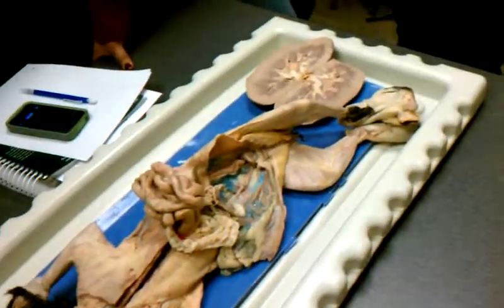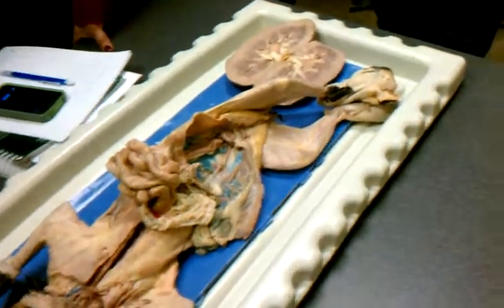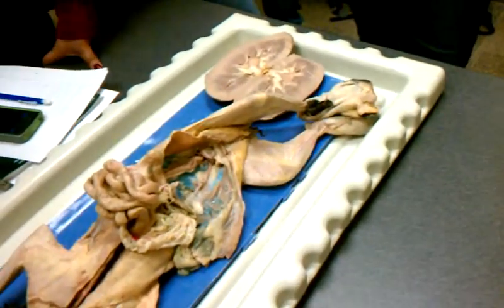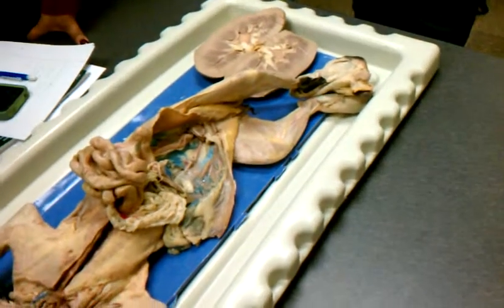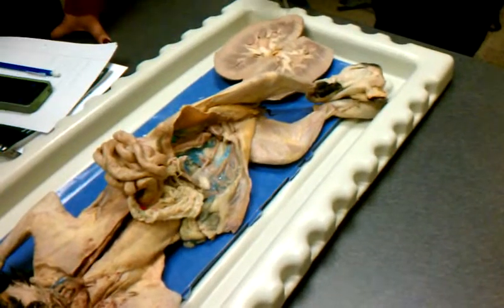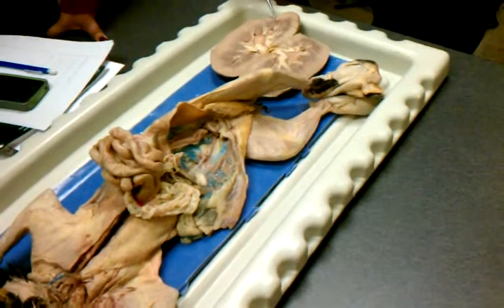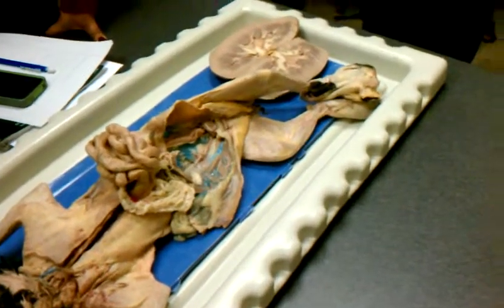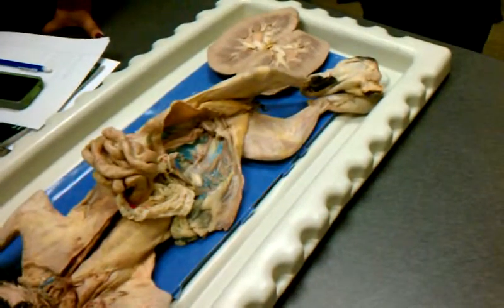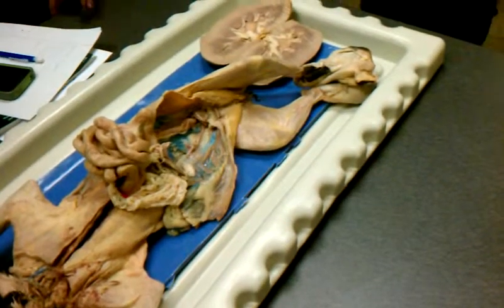How are you going to put a pin if we're going to mark the entire medulla compared to a pyramid? So you would say region, or would it be? If you're going to have a number on a pin. So I just have a single pin stuck in here, or a bracketed area that is this region just by itself. That would be a pyramid. I probably have to change the wording. Like I would have to say something like, what is the entire darker colored region where the pin is located, or something like that.